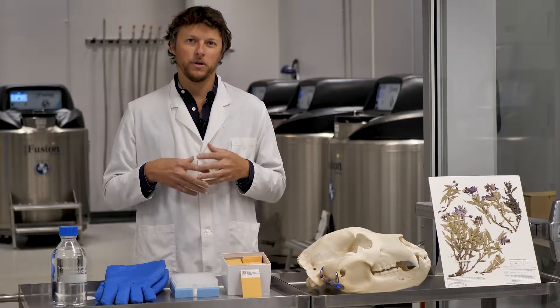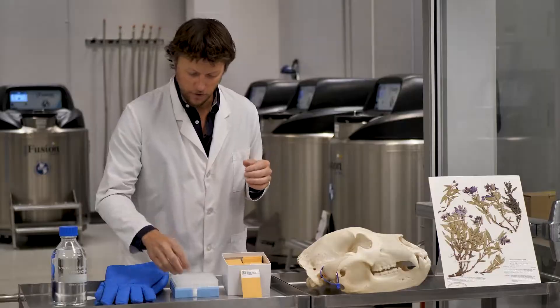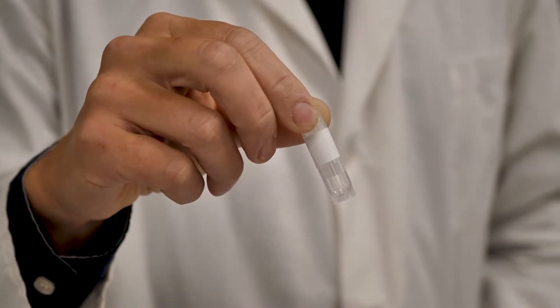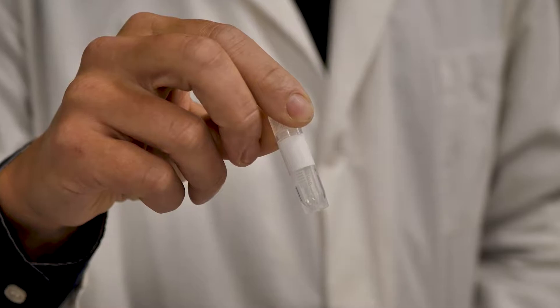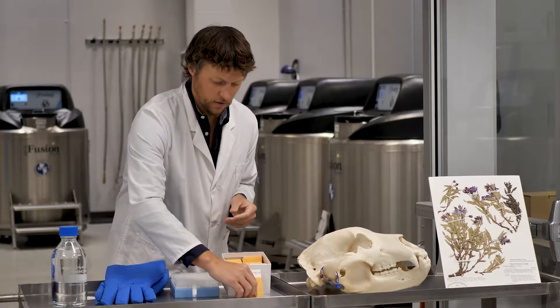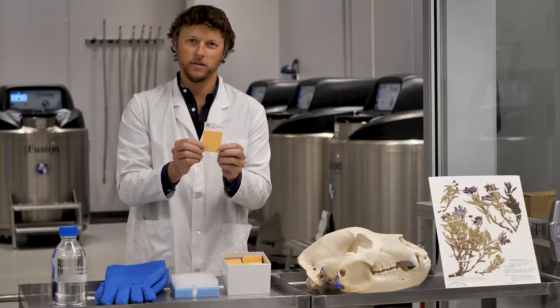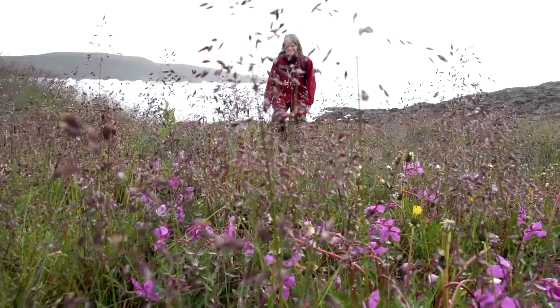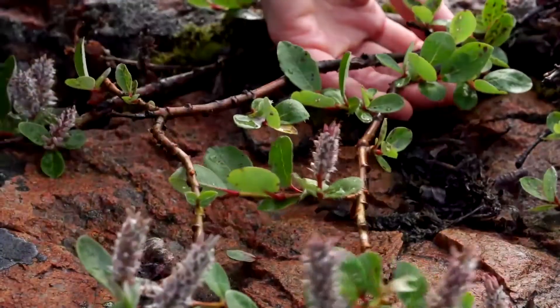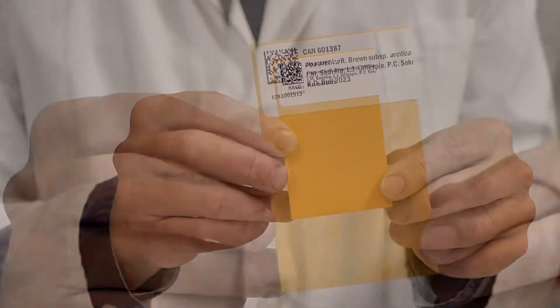Here we store tissue samples. Animal tissue samples are stored in small two milliliter tubes like this — this might be muscle or organ tissue, which are good sources of DNA. For plant tissues, we store them in envelopes like this. So when our researchers are up in the Arctic, for example, they'll collect some nice green tissue, put it in an envelope like this, and this is a good source of DNA.